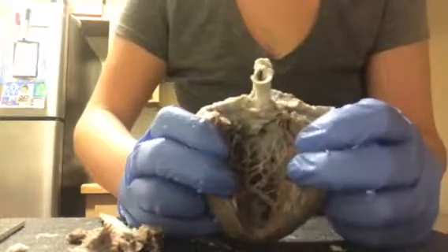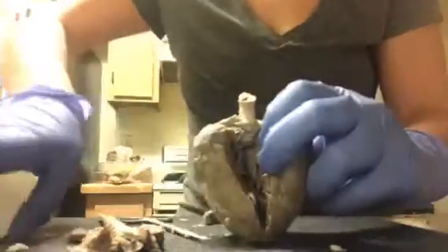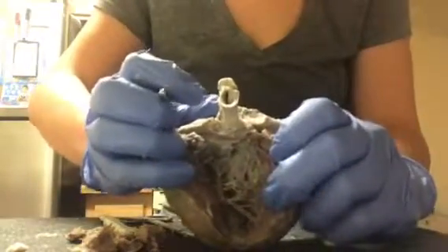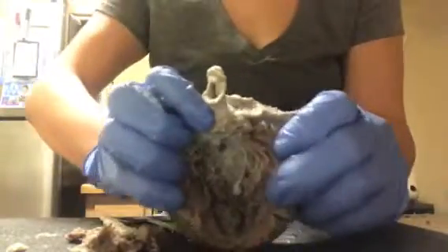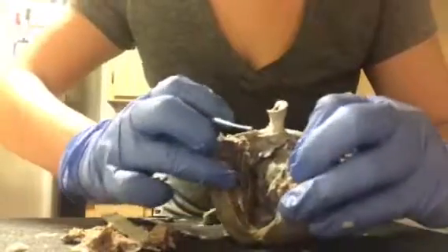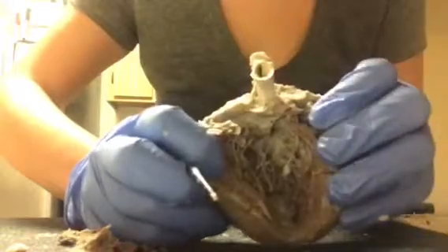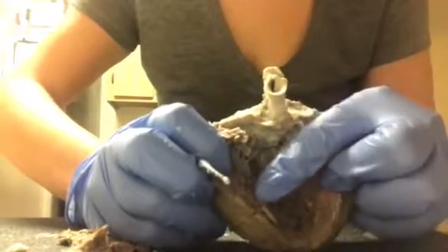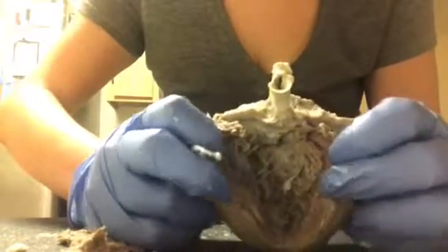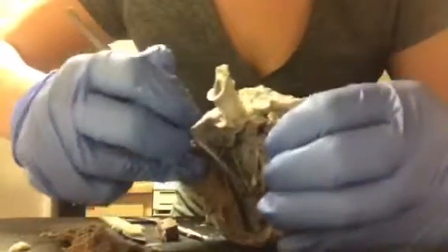So now that it's open, we can point out the left ventricle, which would be, let's see if I can get the lighting. So the left ventricle, opening it all the way up. Oh, I think I just tore a muscle. Okay, so before anything, let me just point out that these little strings over here, I don't know if you can see them, the little strings that are inside in this area are the papillary muscles. On that same side, you will find the left ventricle, which is right in this area.